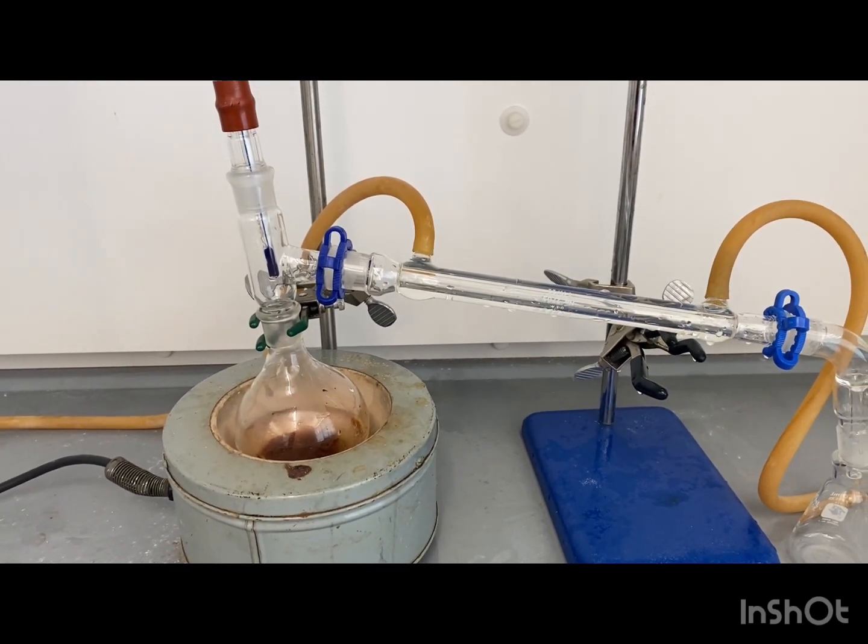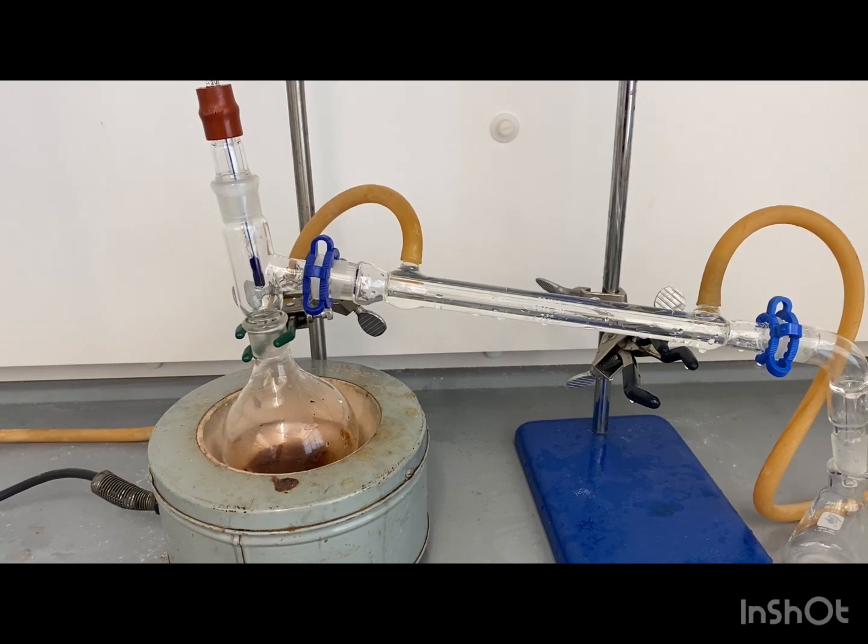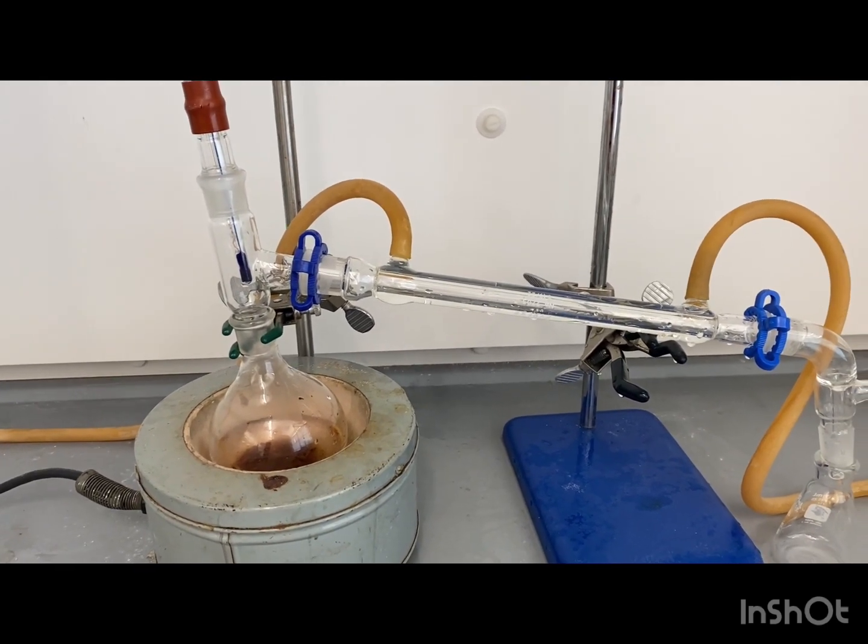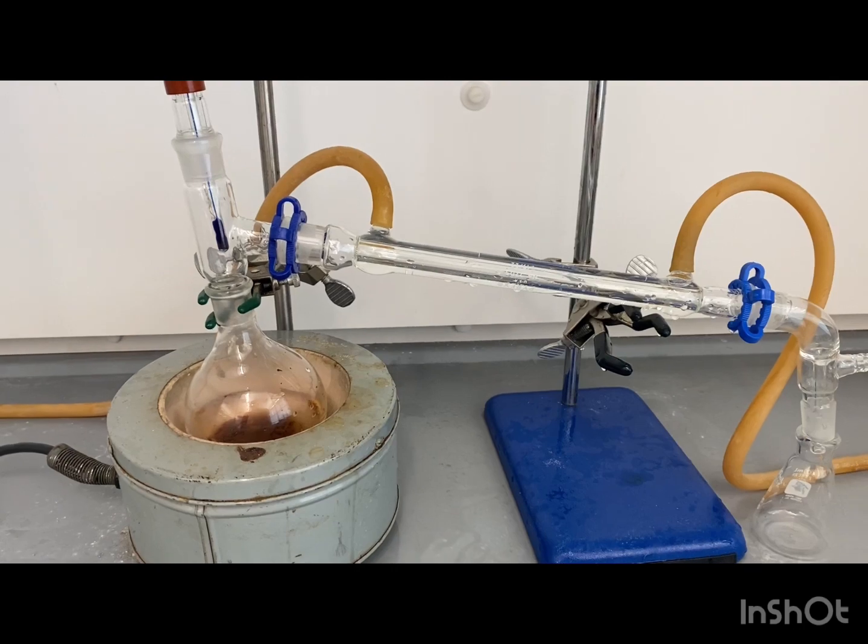We're going to try to watch for the temperature to rise. We're going to see at what temperature we get that first distillate. And we're going to try to collect around 50 ml.